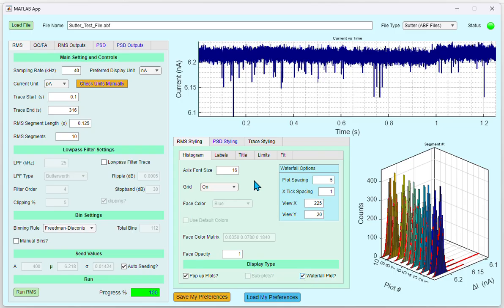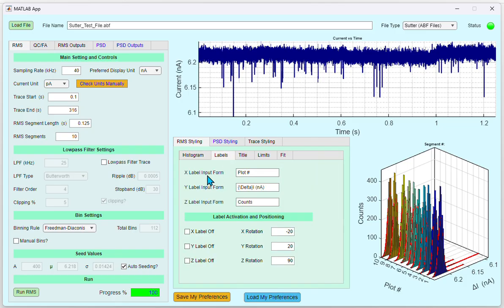Under the Labels tab, you can set the X, Y, and Z labels of the plots. This takes the standard MATLAB input form. By default, X is the plot number, Y is the delta I in nanoamps, and Z is the counts. You can turn the labels on or off if needed using these radio buttons, and you can also play with the rotation of the labels using these options.